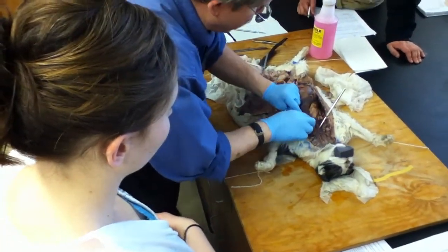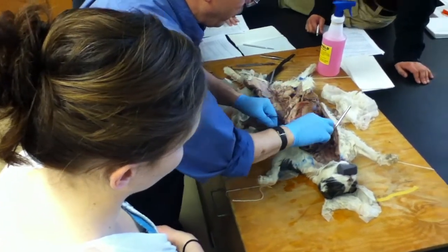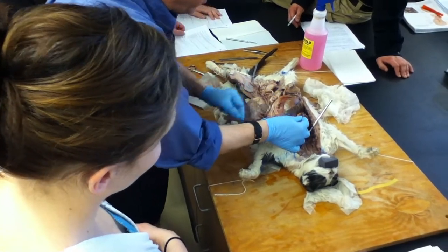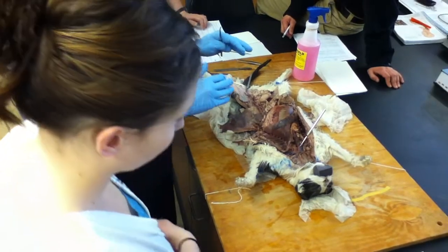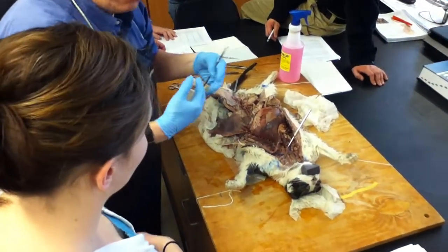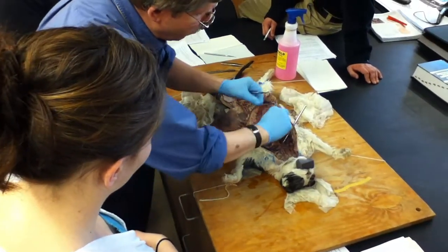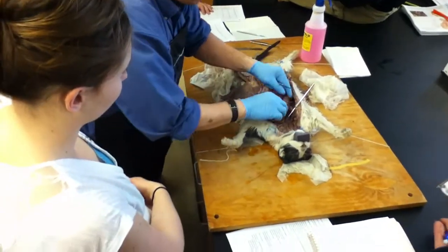And basically it's because the lungs are in the way, and all of this fatty material right here is all fat and part of the thymus gland, which is this stuff here, which is sitting on top of the pericardial sac. So the thymus gland, which we'll talk about next term because it's part of the immune system, basically sits along here and actually covers most of this area right up over the great vessels. Okay.